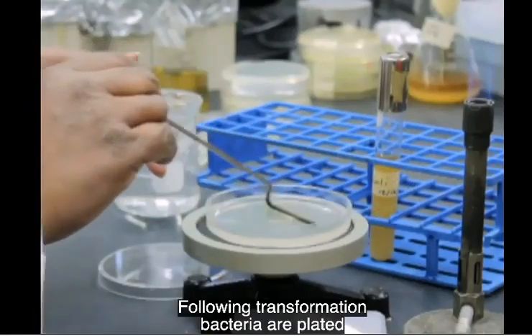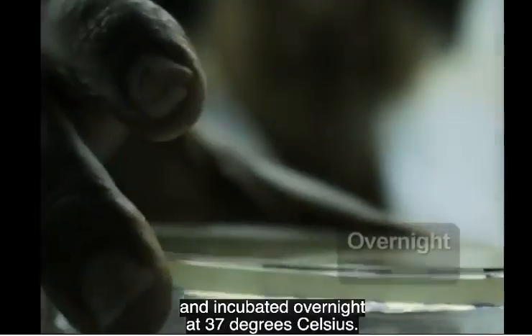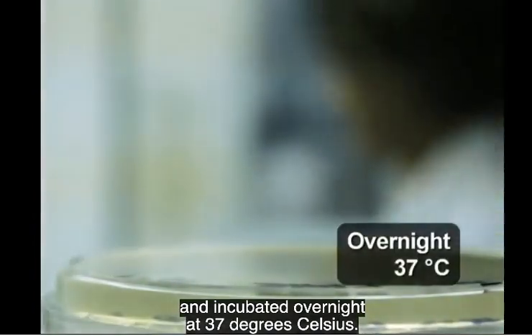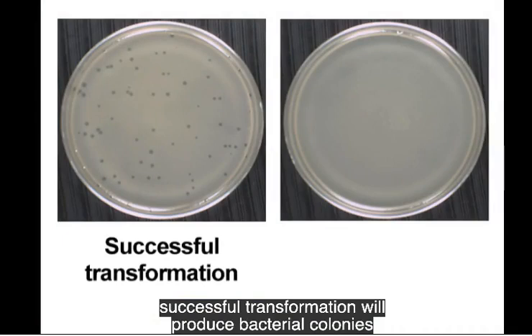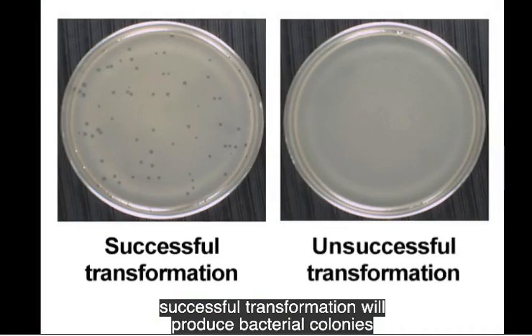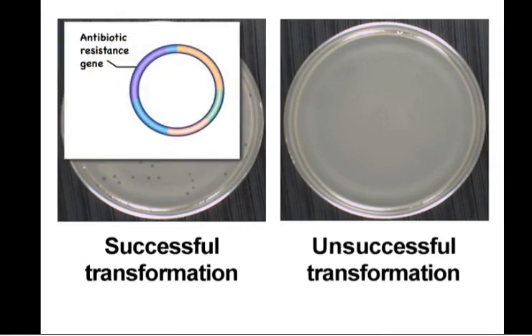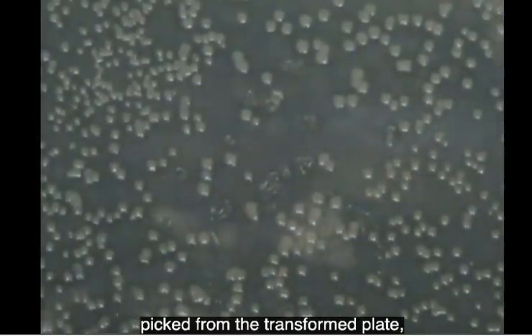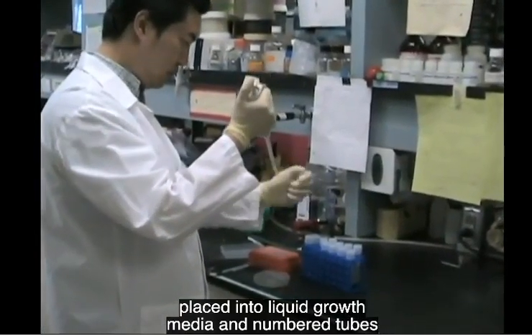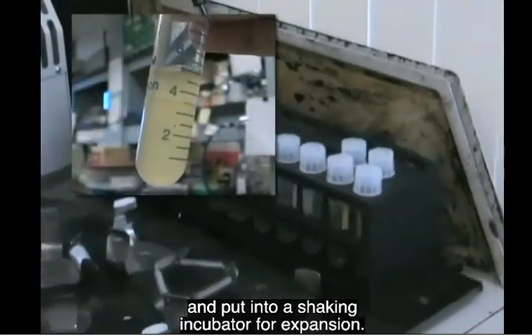Following transformation, bacteria are plated on agar plates with antibiotic and incubated overnight at 37 degrees Celsius. Because the plasmid contains an antibiotic resistance gene, successful transformation will produce bacterial colonies when grown on agar plates in the presence of antibiotic. Individual colonies can then be picked from the transformed plate, placed in the liquid growth media in numbered tubes, and put into a shaking incubator for expansion.